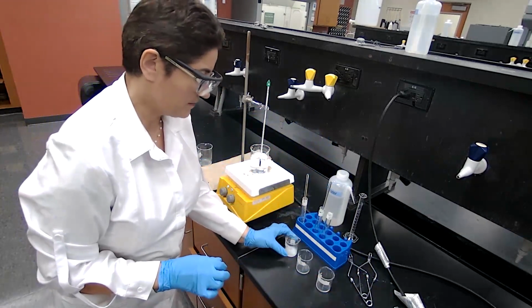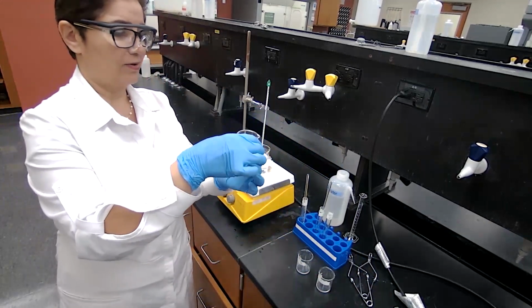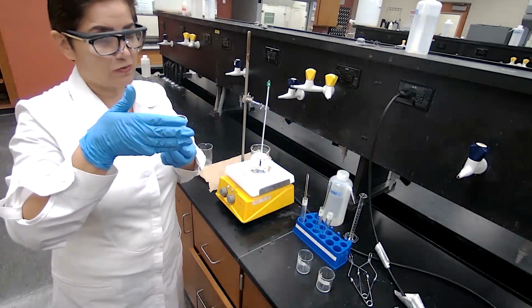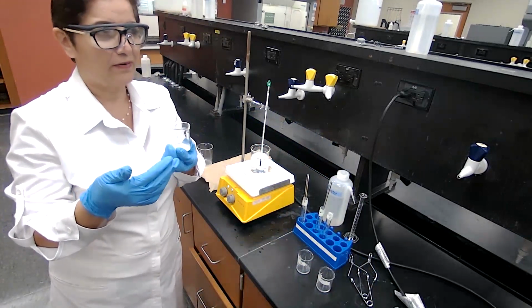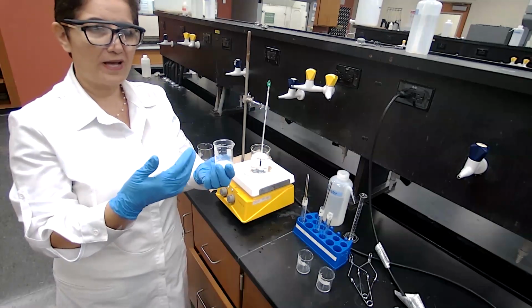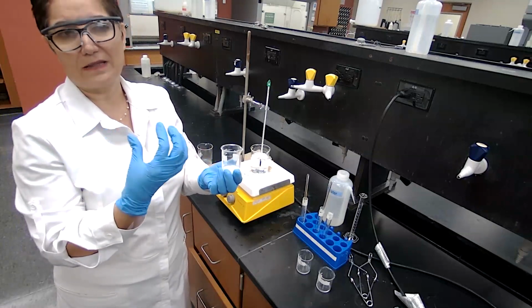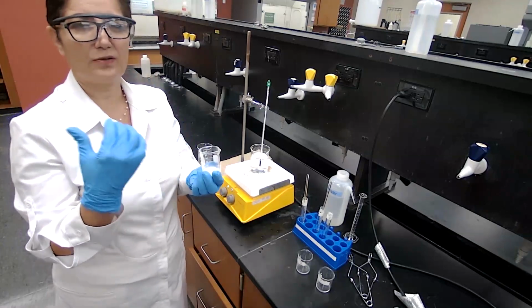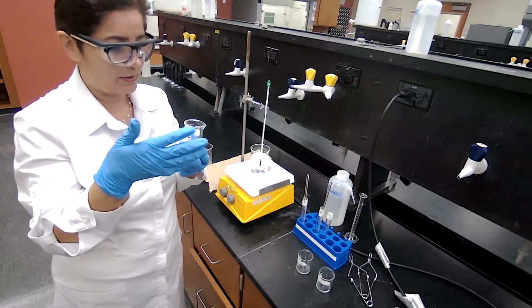Now, you have to kind of trust me, because you're not here to smell or test for the odor. The proper way is to waft the vapor toward your nose. You don't want to go very close to it. And you want to be careful, even though you know it's an ester, because remember we add sulfuric acid to get the reaction going, and you don't want to inhale too much of the acid, as it can burn you.